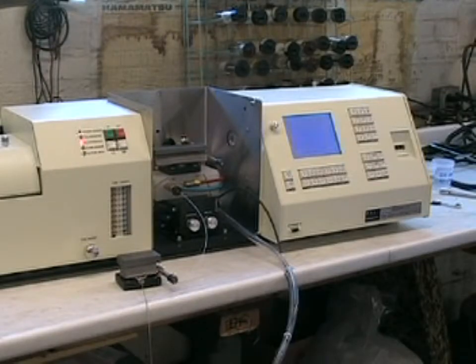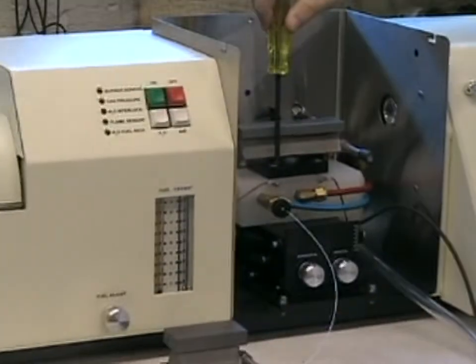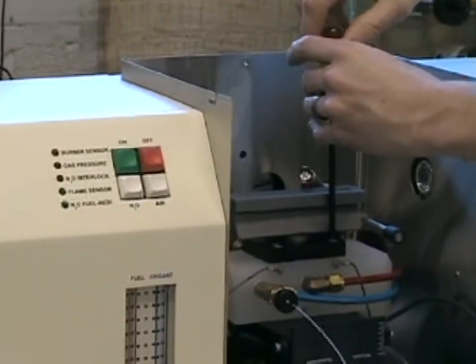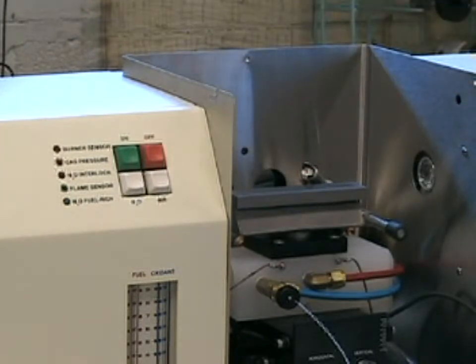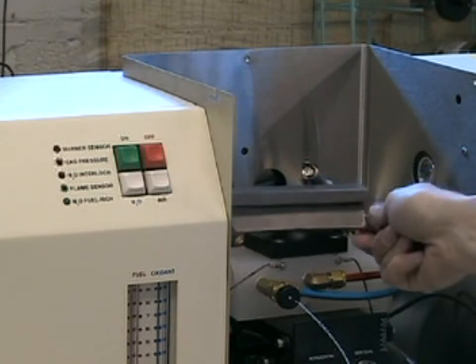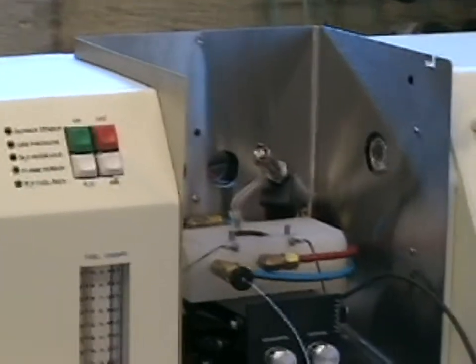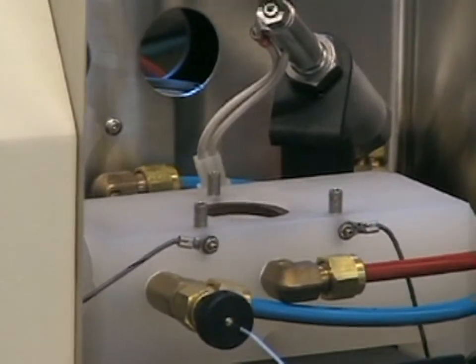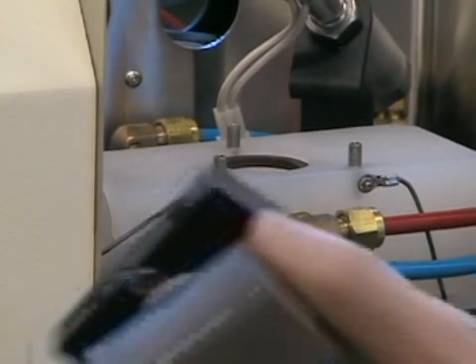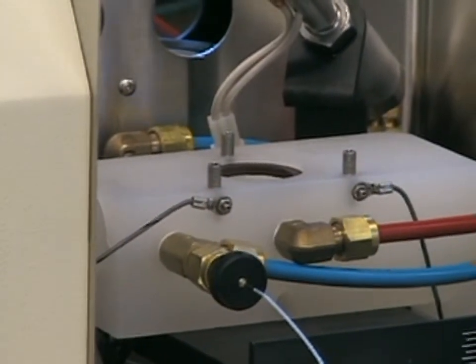To change the burner head, shut the power off to the 211 using the power switch on the right side of the instrument. Then, using the enclosed hex wrench, loosen the cap nuts that secure the burner head to the spray chamber block. If the burner head is hot, use the handle to lift it off the spray chamber and put it aside. Please note that there is an O-ring assembly inside the opening of the spray chamber. Periodically, it is a good idea to check the integrity of that O-ring and replace it with a spare included in your installation kit.